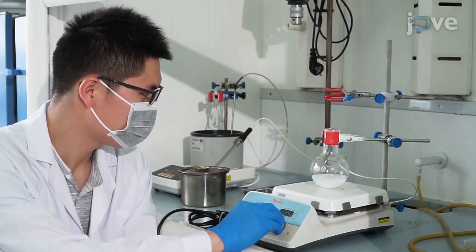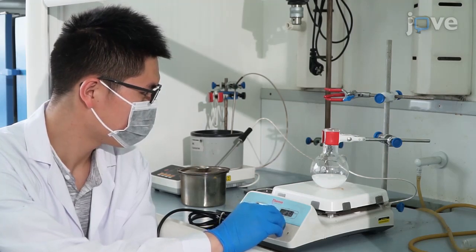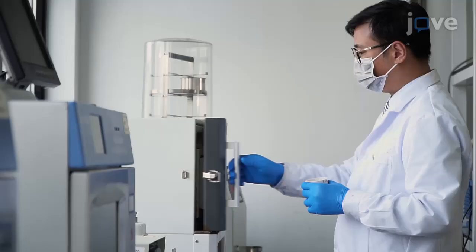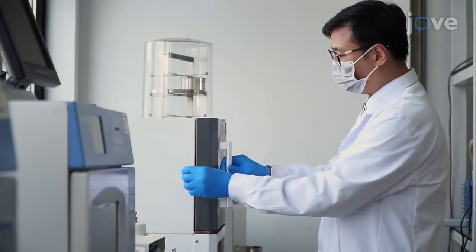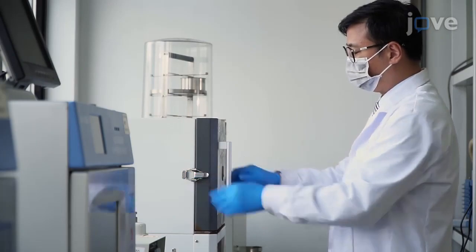This protocol demonstrates a general method to tune the acidity of solid acid nanosheet-modified platinum carbon nanotubes for biomass valorizations. Acidity of the solid acid can be modified by varying the number of defects, specific area of the carbon nanotube, and types of solid acid nanosheet, so that during biomass conversion, the catalyst can be fine-tuned to produce different products depending on different product requirements.